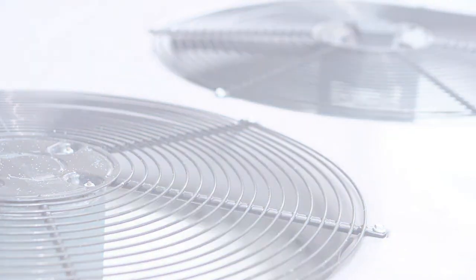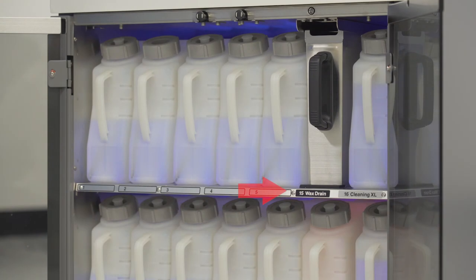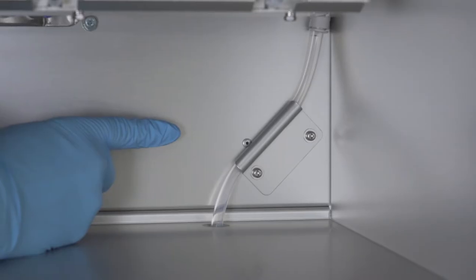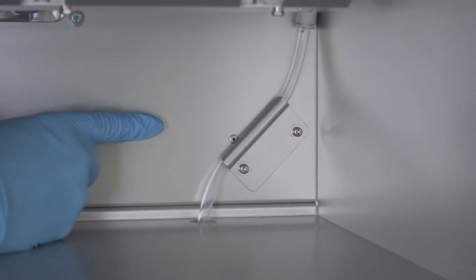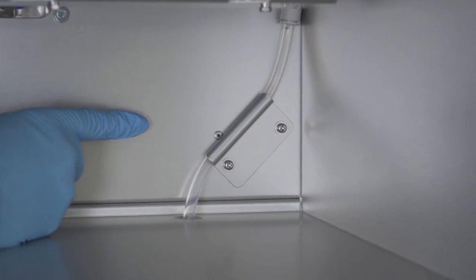There is a wax drain that holds waste paraffin, which can be used to rotate or drain paraffin from the oven containers. The tubing you see on the back wall of the oven goes directly from the retort to the waste drain. It is always heated, therefore it will never get clogged.